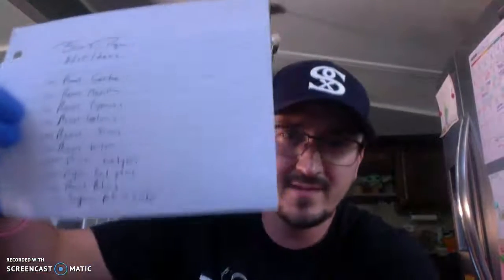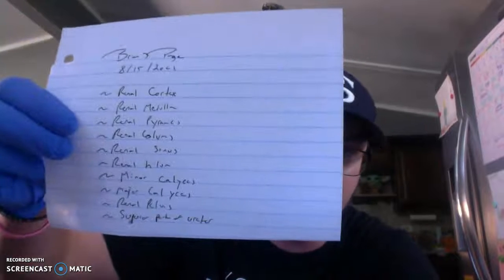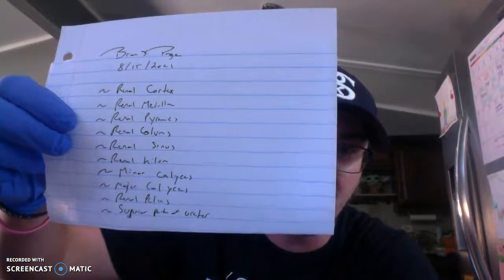Hey, how's it going everyone? This is Brian Page again. I'm excited to say that this is the last dissection that I have to do. It says dissection of the sheep kidney, but actually my kit came with a pig kidney, so I just finished the dissection of the pig kidney. Here's my piece of paper — it says my name, Brian Page. Today is August 15, 2021.